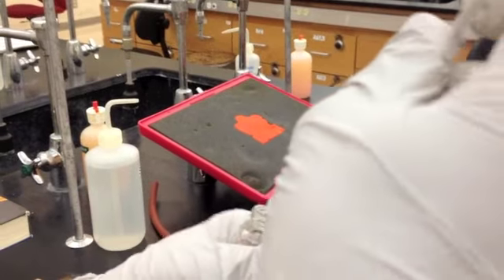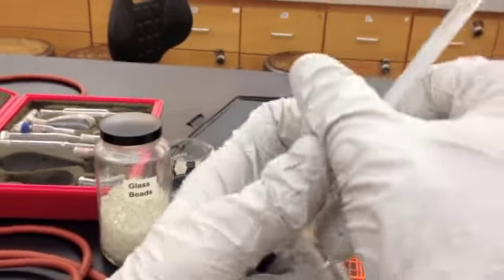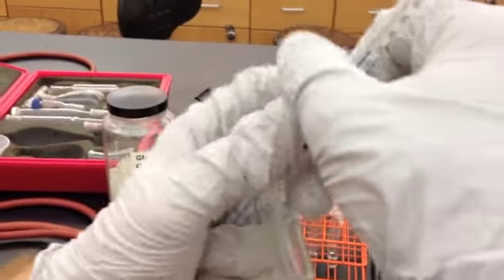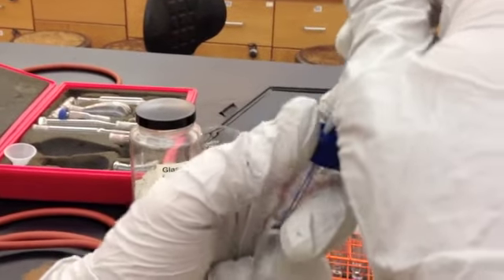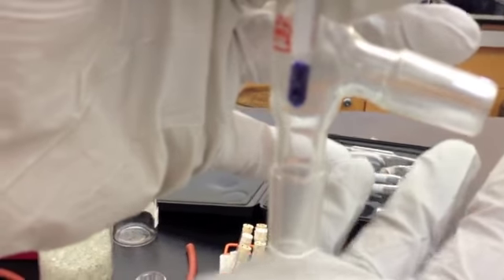Put the thermometer through and then secure it back on. Now, it's very important to make sure that your thermometer, the bulb of your thermometer, is just below the sidearm. Because when the vapors come up, you want the temperature on the thermometer to be the temperature of your vapors that are going to be escaping into the sidearm.